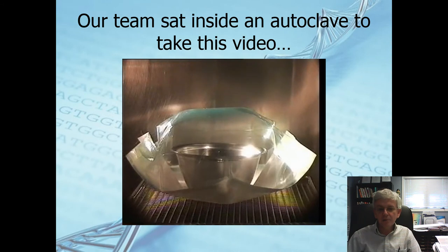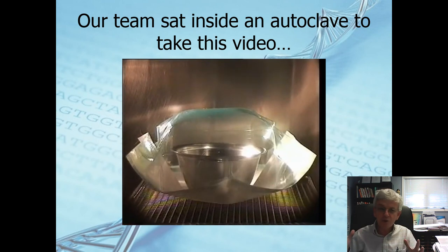So right here, being pressurized. This is the startup initiation of it. Bag is sitting here. It's been poofed up. It is really maxed out. This thing is being held together.